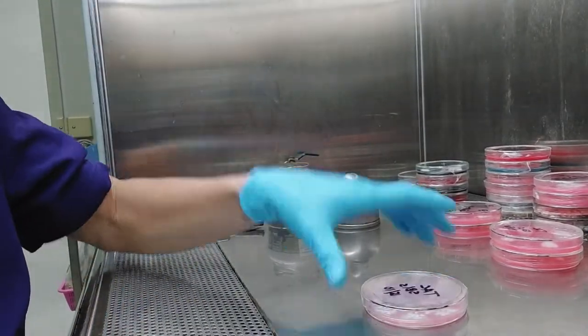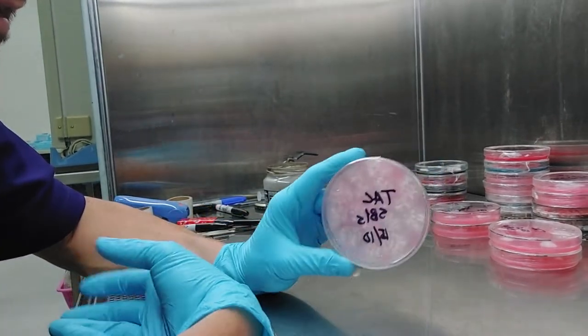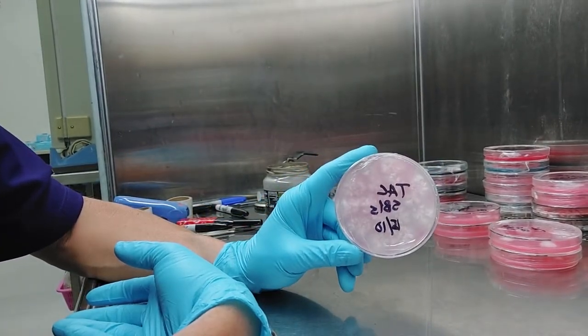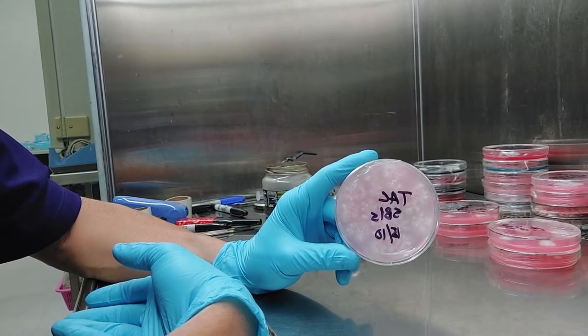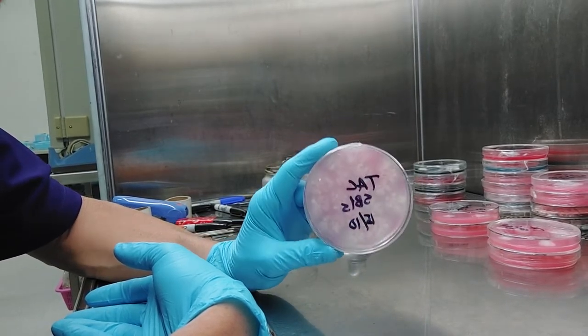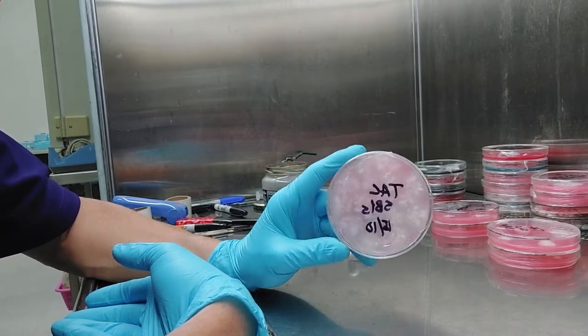Hello everybody. I'm not really sure where to start with this video. What I'm trying to do is isolate monocaryon cultures from a spore swab. In order to do that, I did a dilution method, which is in another video called the ghetto swab dilution method.